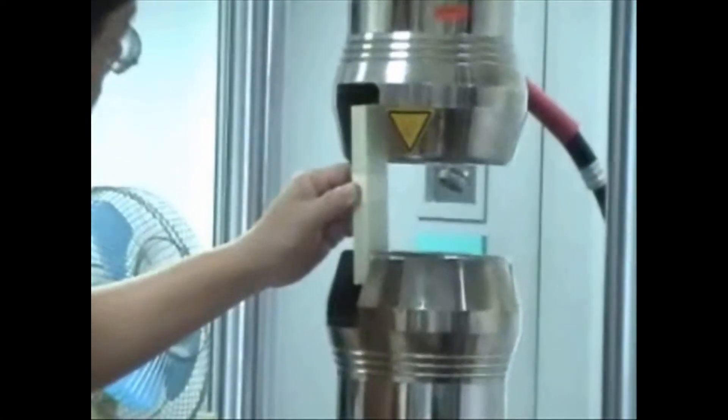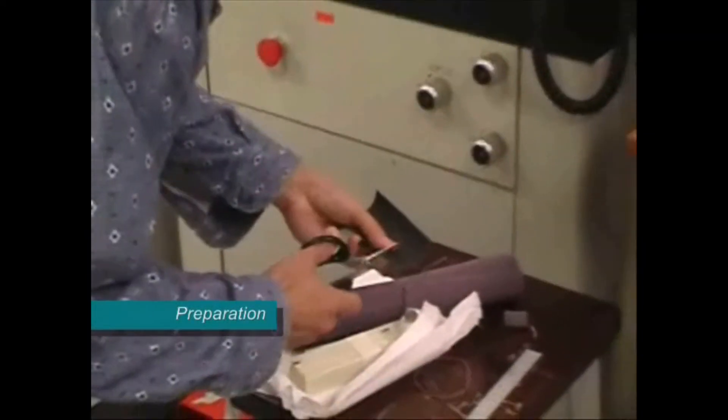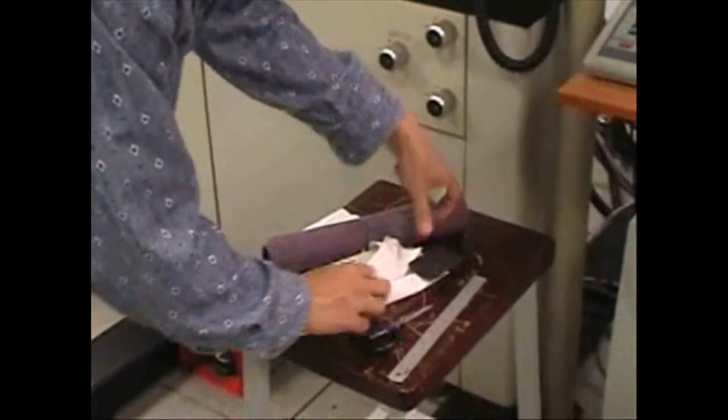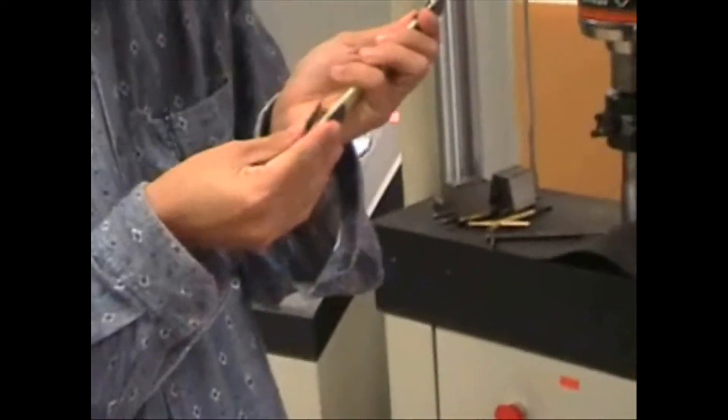Here we have glass fiber reinforced epoxy and the volume percentage of fiber is about 70%, and the fiber is in the form of fabric. Here you can see the specimen, the long specimen, and we are making the grip for this specimen.